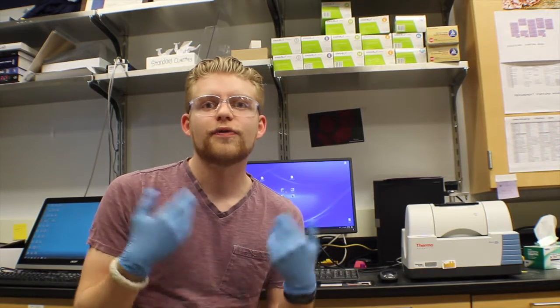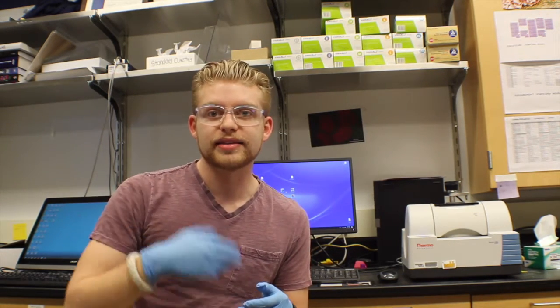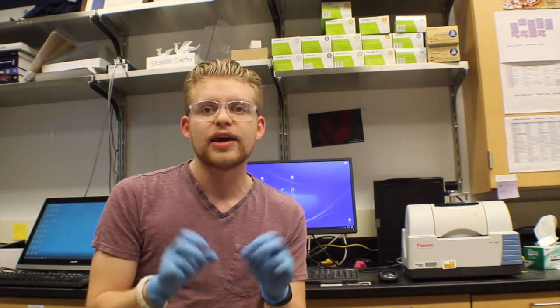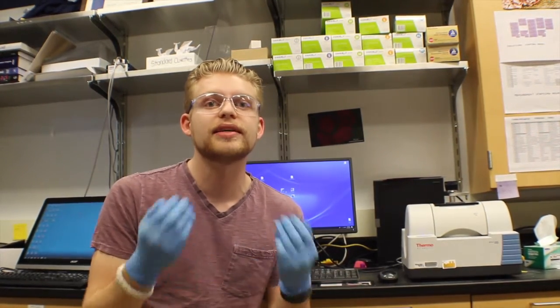Hello everyone. For our MIL project for MSE 3720, our group used the Fourier Transform Infrared Spectroscopy process to identify our different materials. We're going to send a beam at our materials and figure out how they react to it, looking at their different absorptions, wavelengths, and frequencies in order to identify different functional groups in the materials so we can identify what we're actually working with.